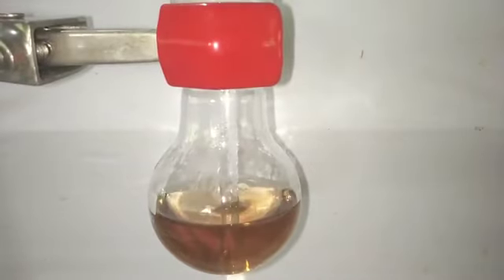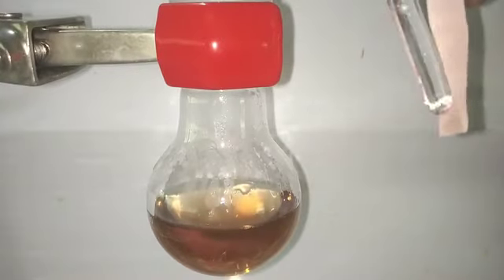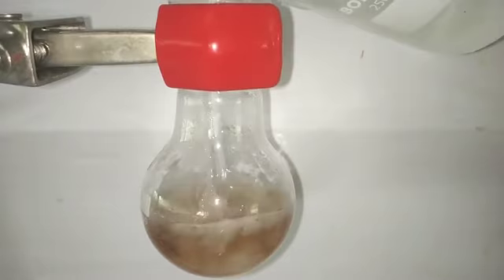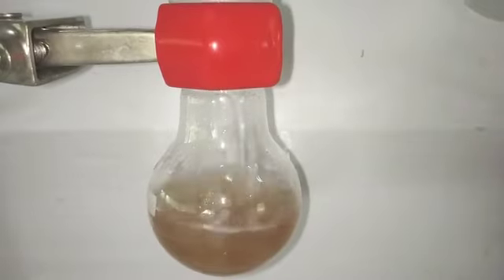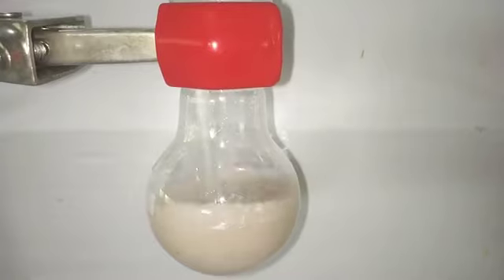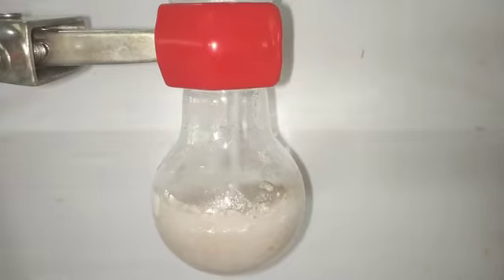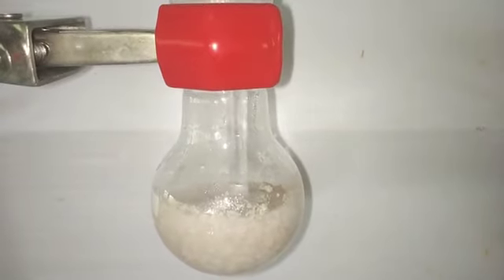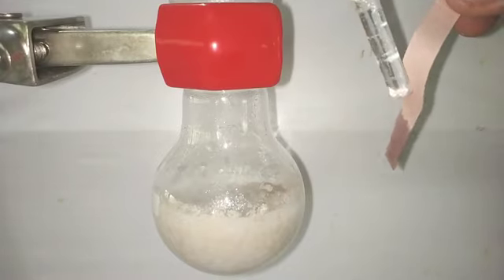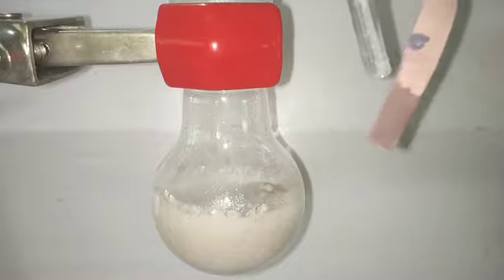You can note that on adding the 3 molar sodium hydroxide solution, it will form a white precipitate which will immediately get dissolved back into the solution. This is similar to attaining the end point in titration. After some time on adding the 3 molar sodium hydroxide solution, the white precipitate formed will not go back into the solution, indicating that the neutralization has been achieved. And you can test that again by taking a drop of the solution and placing it on a red litmus paper, and you can see that it has turned blue, indicating the end of the reaction.